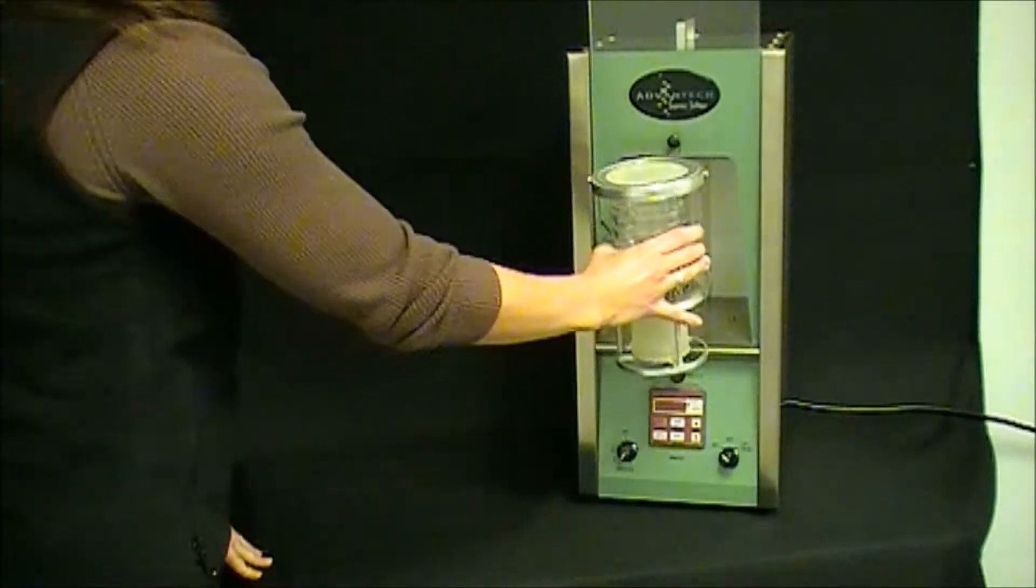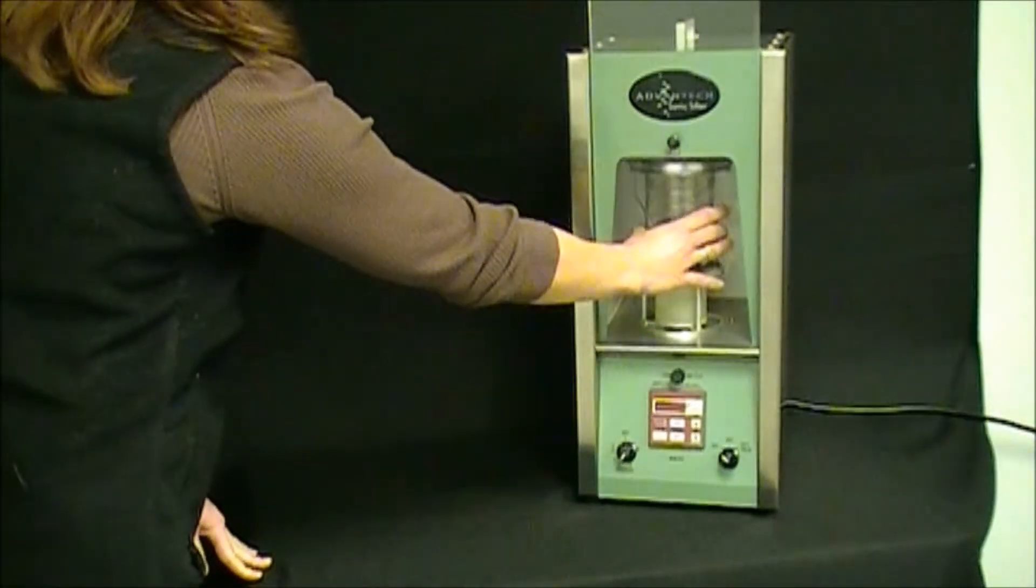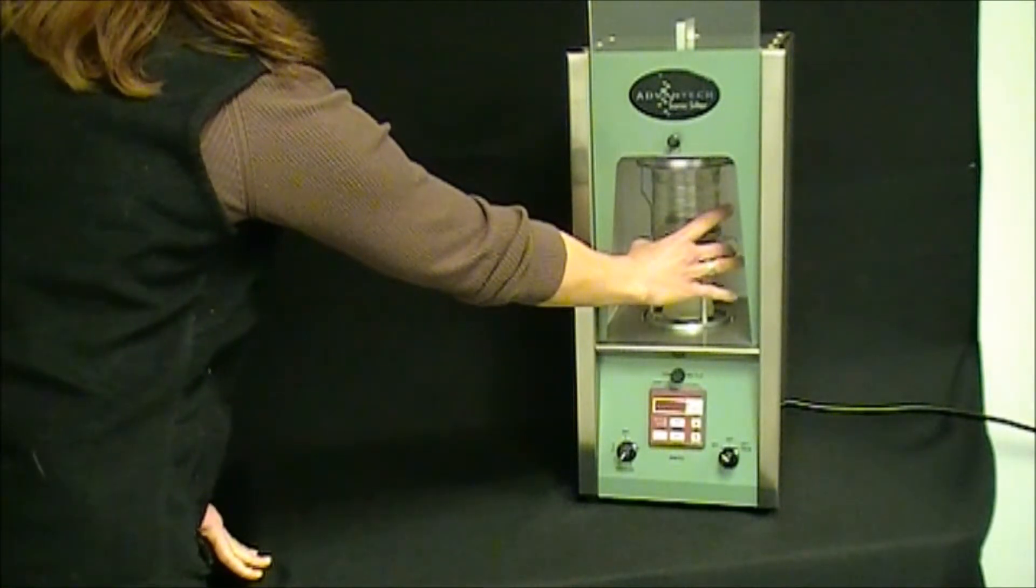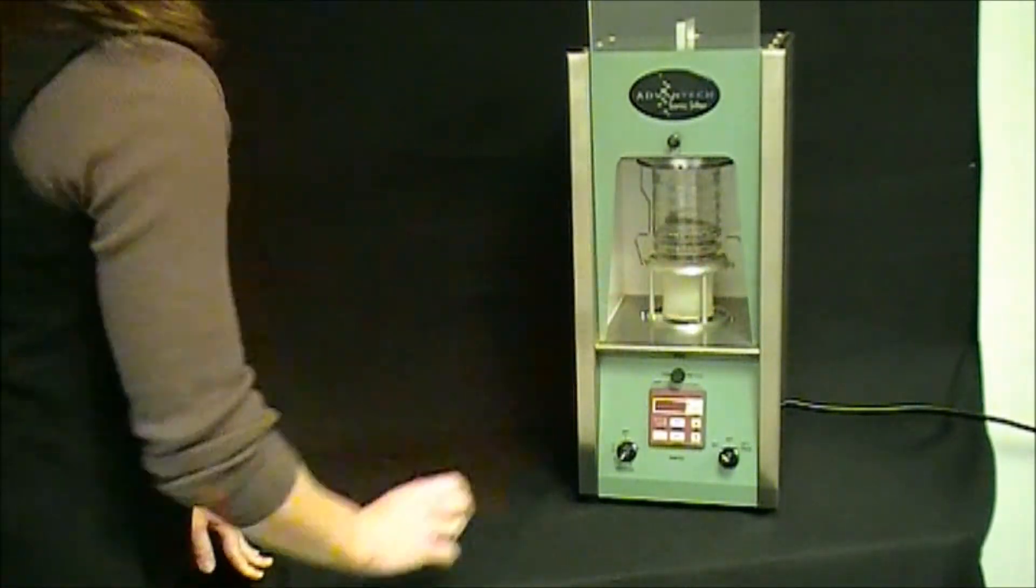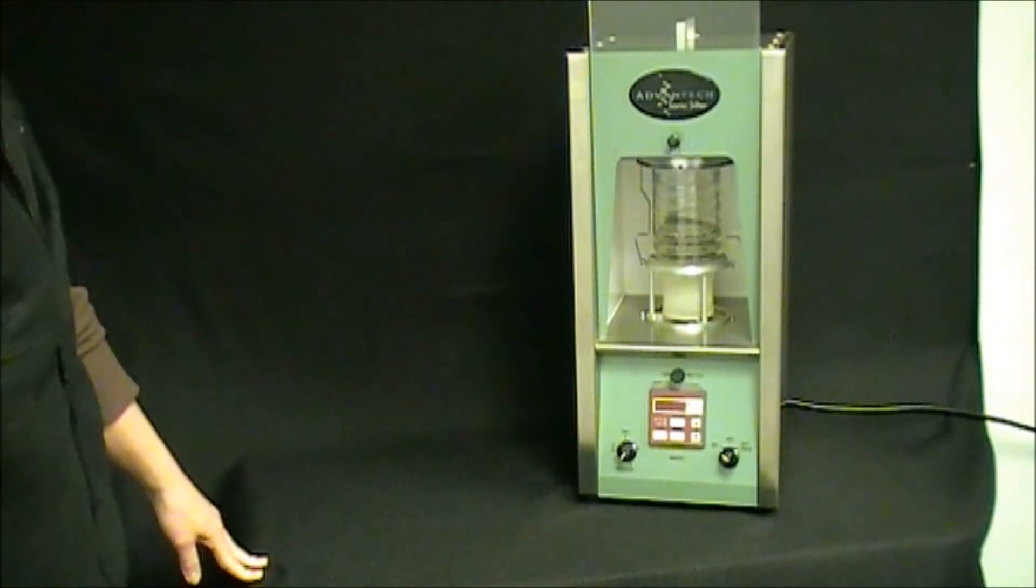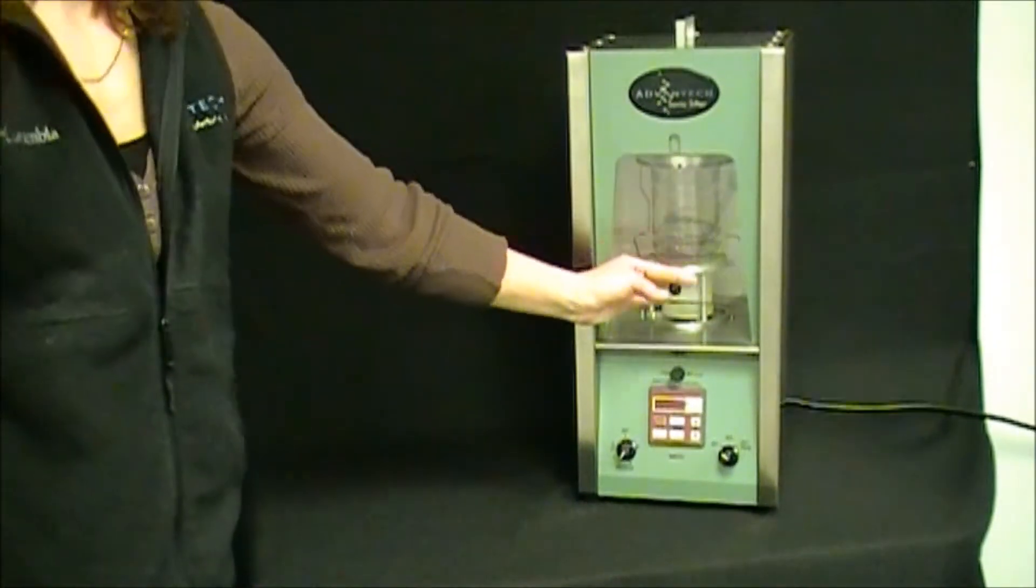Insert the test stack completely into the test chamber engaging the table switch. Release both the arms and your test stack is now secure in the test chamber and you're ready to begin your test.